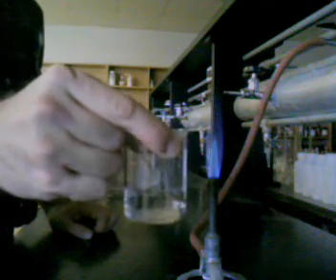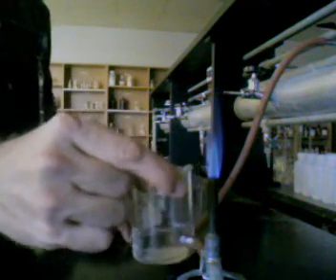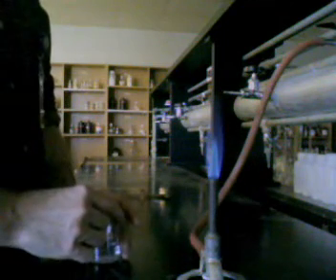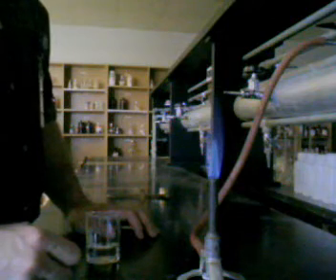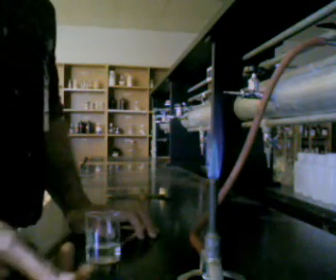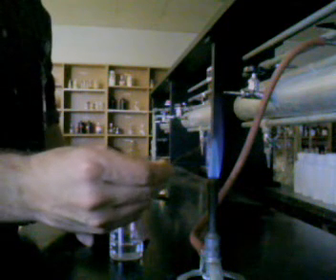Normally, if I get a solution and I don't know what's in it, a solution that has some metal ion dissolved in it, and I want to get an idea of what's in that solution, I can perform what's called a flame emission test. The flame emission test uses a wire loop, like this piece of copper wire, or it can also use a glass stirring rod. How this is done is you dip the loop into the test solution and you place it in the flame, the hottest part of the flame.